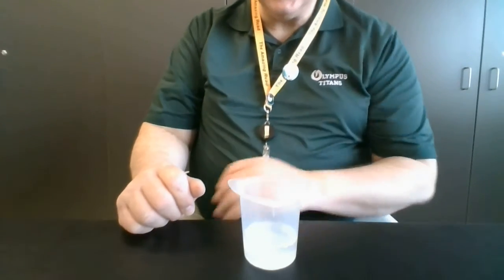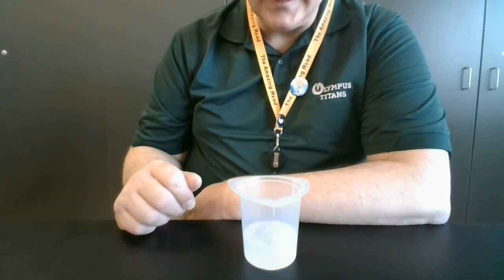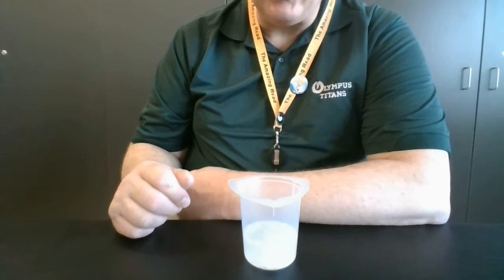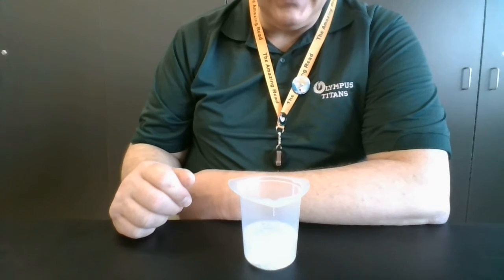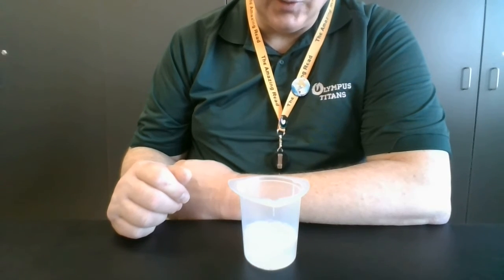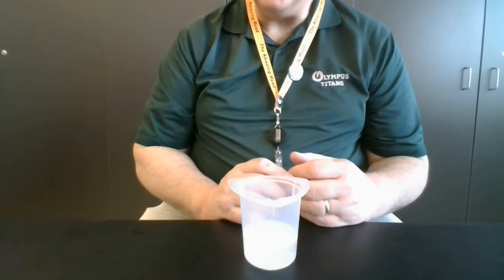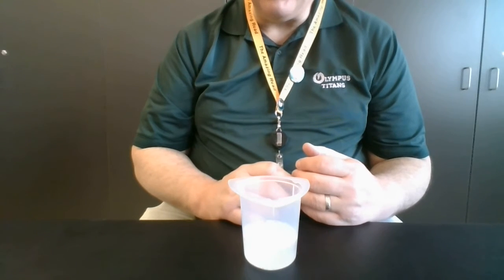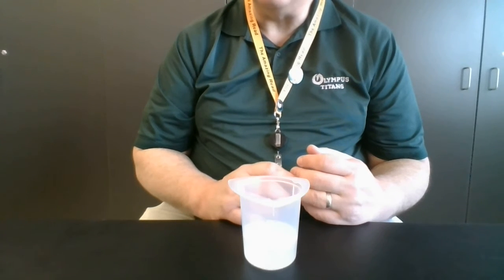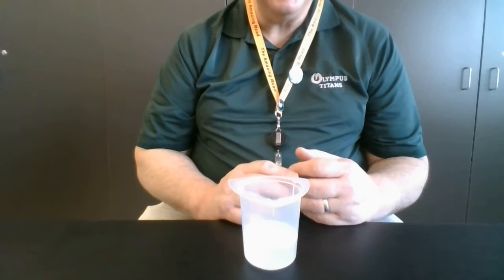I don't know if you can hear it at your end, but I can certainly hear the fizzing as this reaction goes on. As you know from the pre-lab questions for this experiment, one of the products of this reaction is carbon dioxide, and so that's what causes the bubbles. We're actually going to talk about carbon dioxide this week in terms of a reversible chemical reaction. Carbon dioxide in your bloodstream actually plays an important role in regulating your blood pH, which is useful.